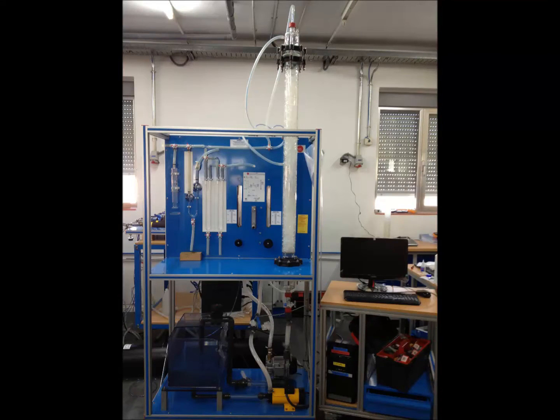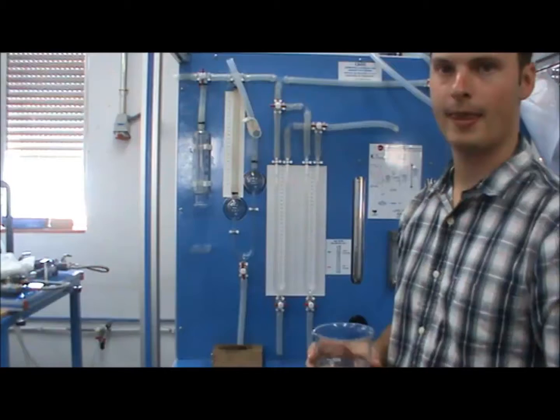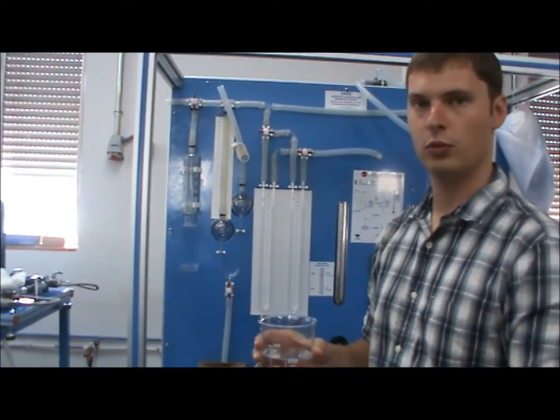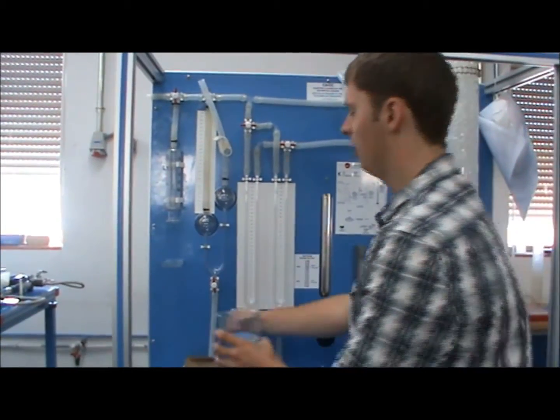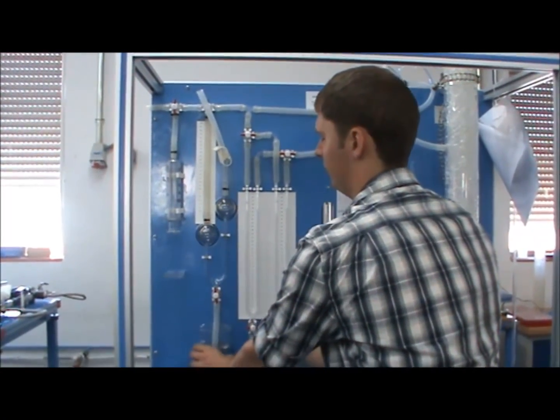In this video, I will demonstrate how to determine the CO2 content in an airflow using the CAGC unit. First, fill the container with this KOH solution and place it here, like this.